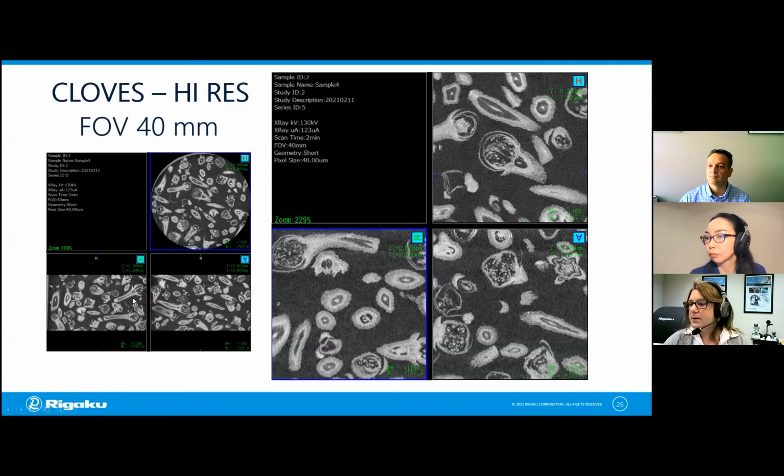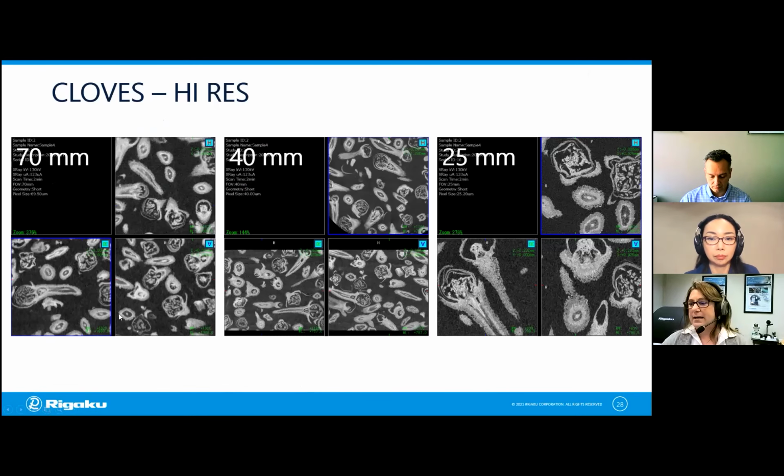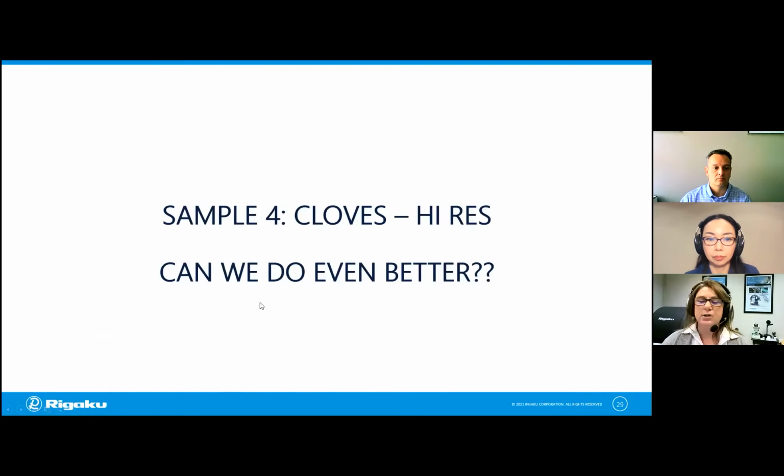If we go to 40 millimeters, in this case, we're only seeing the interior of the plastic container, but we are gaining some resolution. It's less fuzzy, and we see some details inside. But finally, if we go to our different container, 25 millimeter field of view, we start to pick up these voids and other details inside. So you might ask, you probably could do even better, right? Well, that's our last question. Can we do even better?